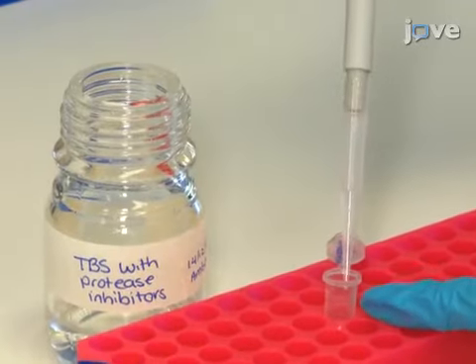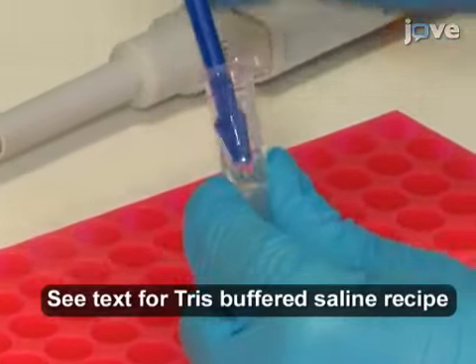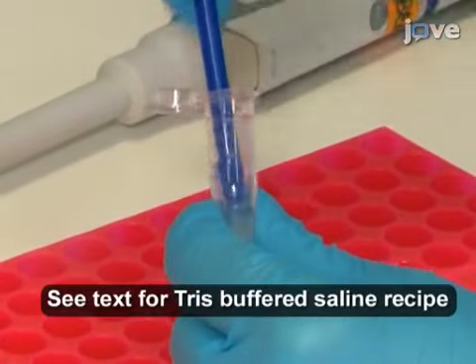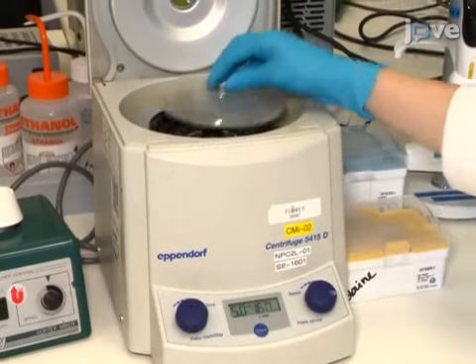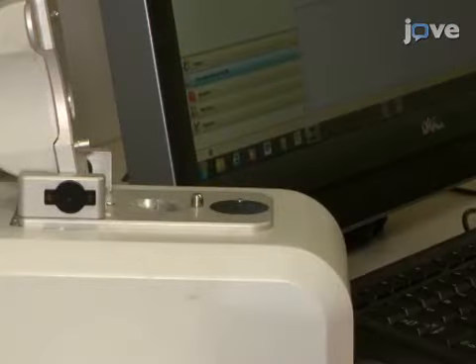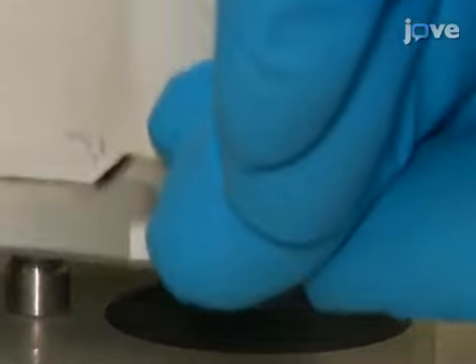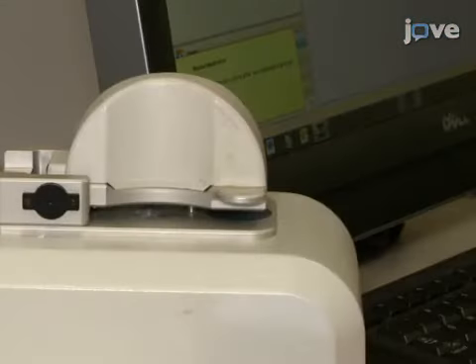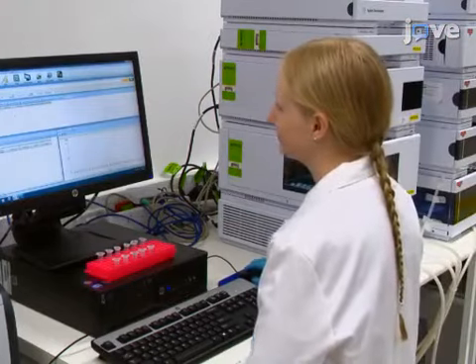To begin, homogenize tissue or cell culture samples by manual dounce or sonication for 5 minutes using tris-buffered saline. Clarify homogenates by centrifugation at 16,000 times G for 5 minutes. After collecting the resulting supernatant, normalize the total amount of protein by determining the protein concentrations as described in the text protocol. Warm up and tune the inductively coupled plasma mass spectrometer using the manufacturer's protocols.